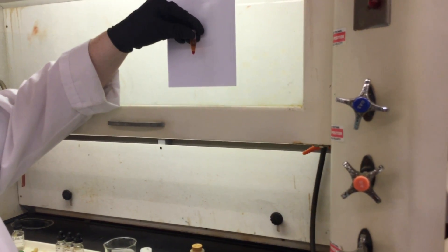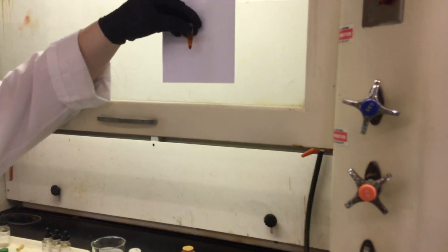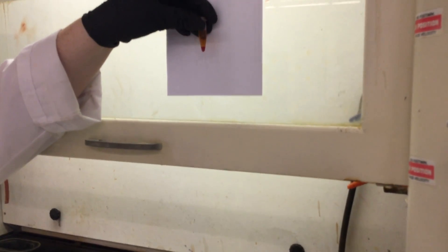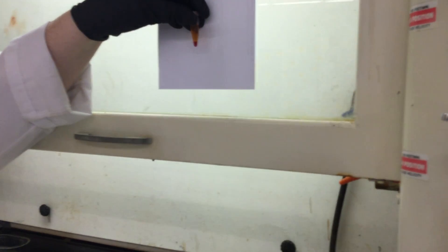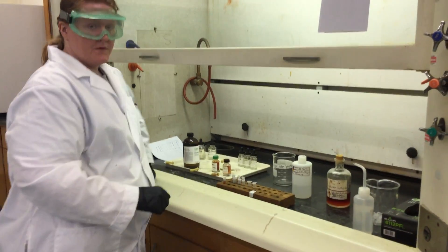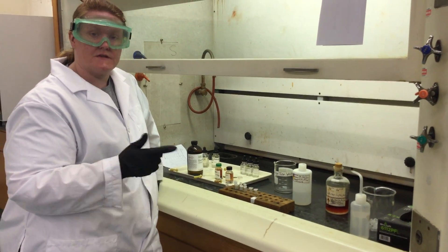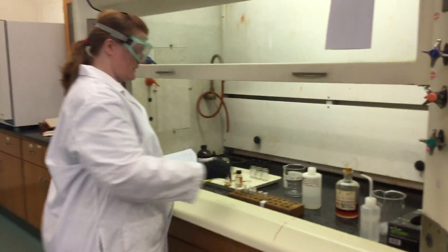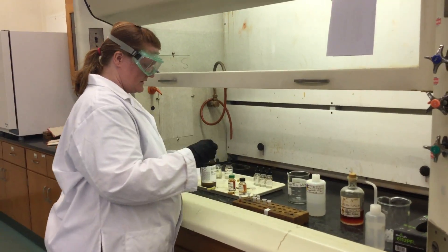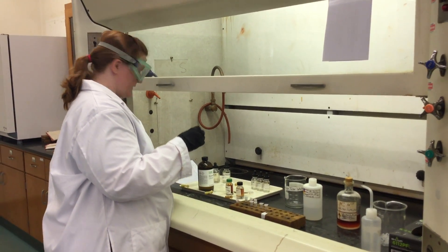Okay, so this is our first line. What we see is that pink forms, so our first observation of the bottom layer is that pink is present—that indicates I2 was made. You can see we filled in for you the I2 as one product, which means Cl- is your other product. We'll walk through the logic of the rest of that form together, but that's how we get the products based on observation.